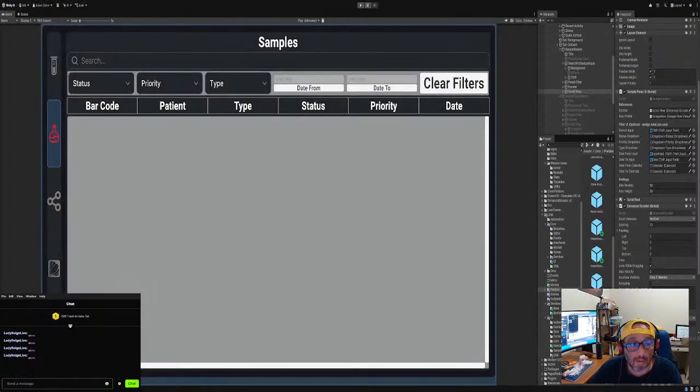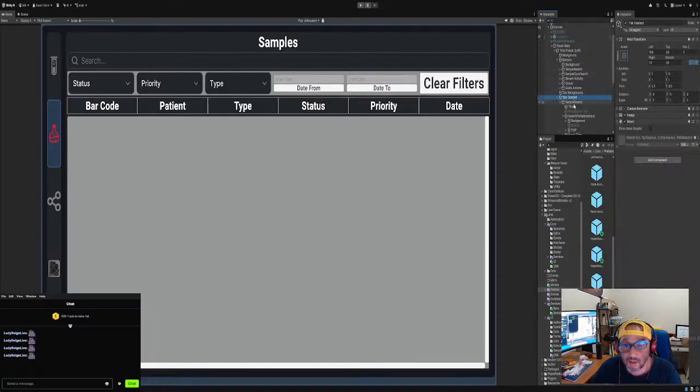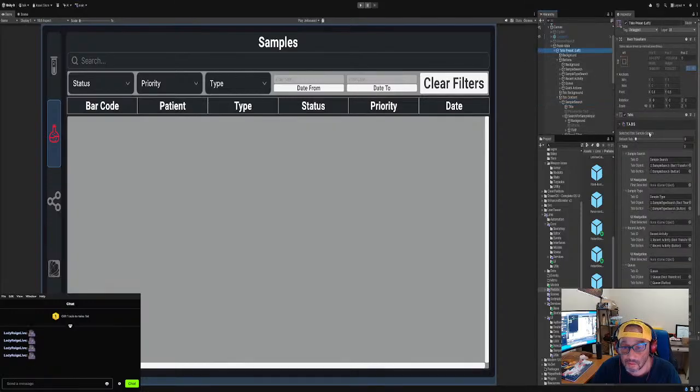So when we go back to the main menu screen, let's start and press play. Make sure this is on the actual tab that we want to start. Let's see, add tab. Okay, I guess it's the right one. Samples, yeah, right one, samples.